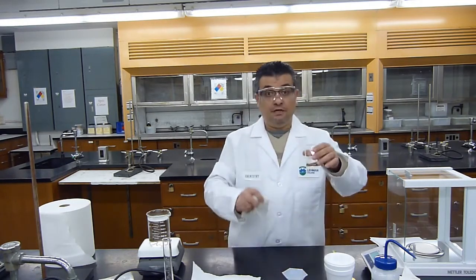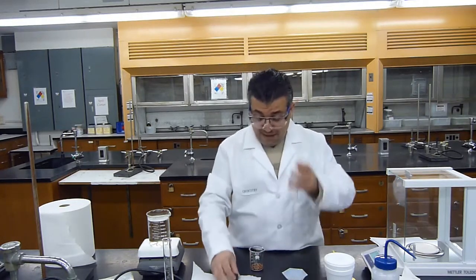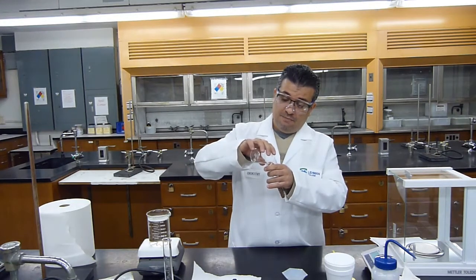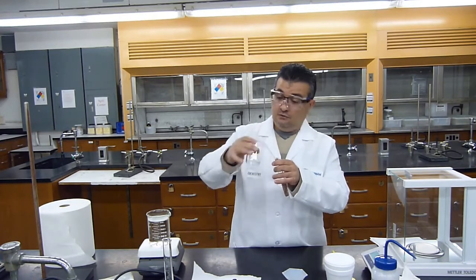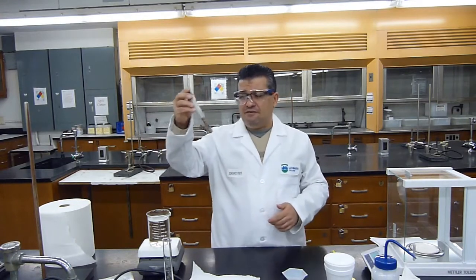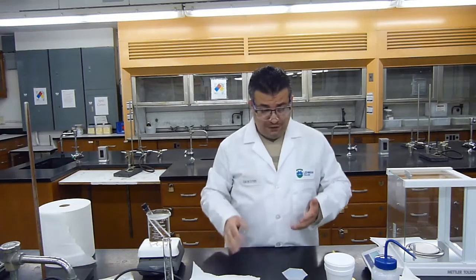Okay, the metal should now be dry. Okay, I will put the metal back in the test tube, and since I didn't lose any of the metal, I don't have to reweigh it. Because the mass of the metal and the mass of the test tube, since I didn't lose any, will remain constant. And now I could wait until the water comes to a boil, okay, and begin my timer. But in the meantime, I'm going to have my metal sitting in this water until it comes to a boil, okay?